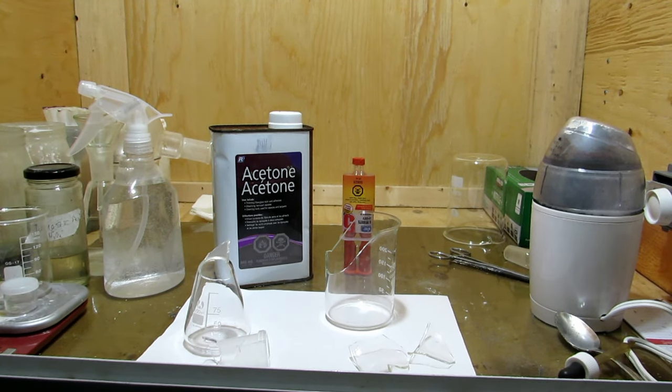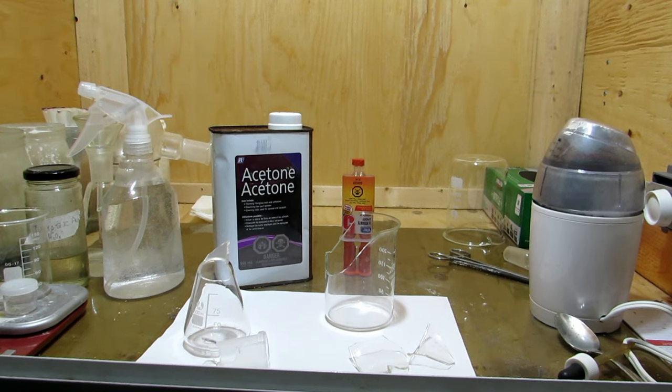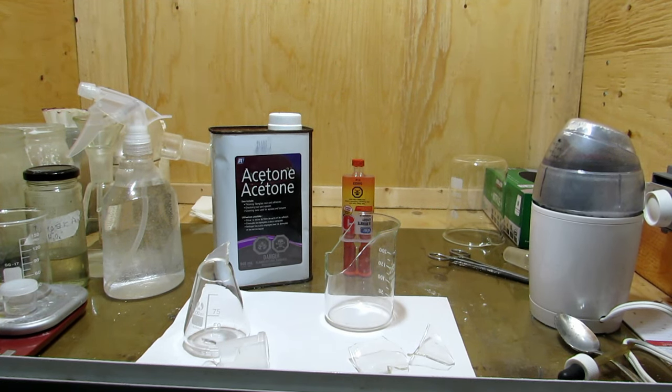Hey guys and welcome back to another video. Everybody who's a chemist typically breaks glassware at one point or another.